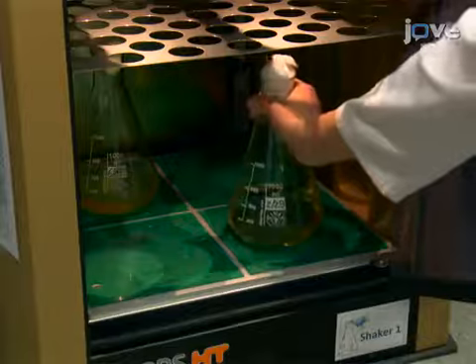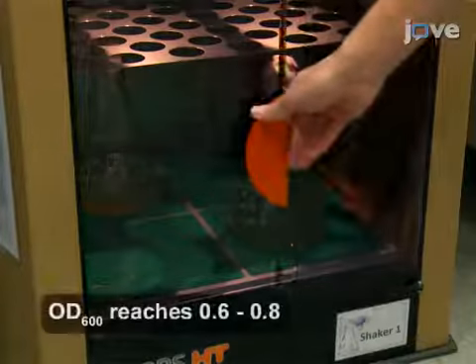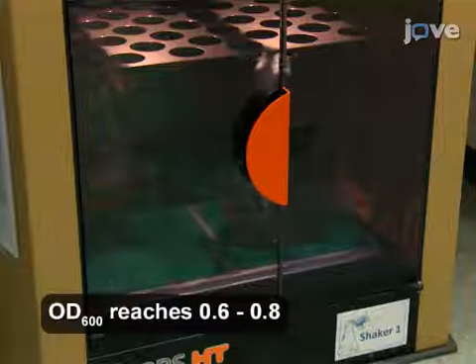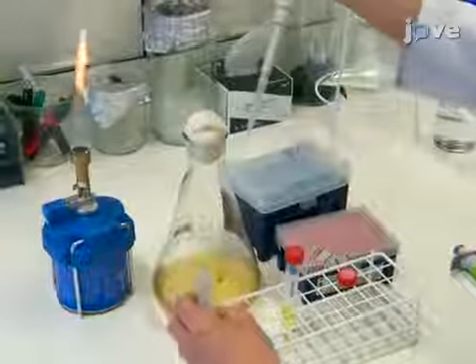Incubate the flasks in a shaker at 37 degrees Celsius and 180 RPM until the cultures reach an optical density at 600 nanometers between 0.6 and 0.8. Next, add 0.5 millimolar of delta-aminolevulinic acid to the cultures.